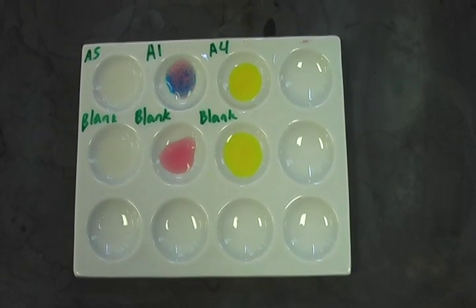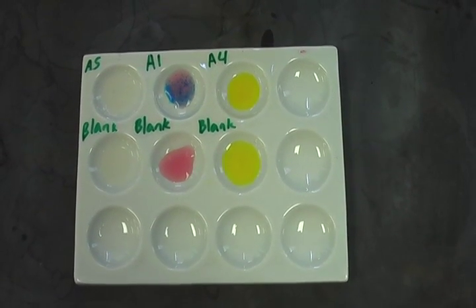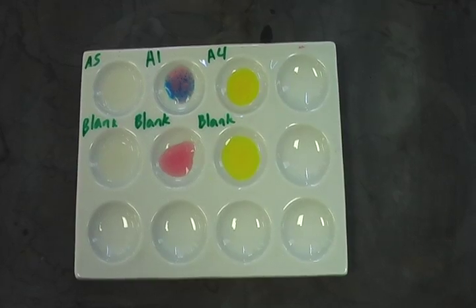Based on the progression of color changes, it can be concluded that our standard sample of cocaine is, in fact, cocaine.